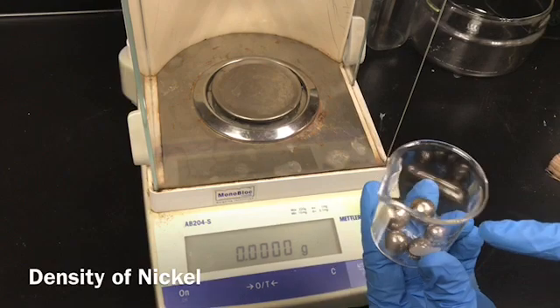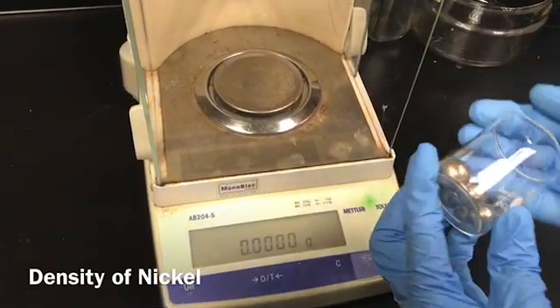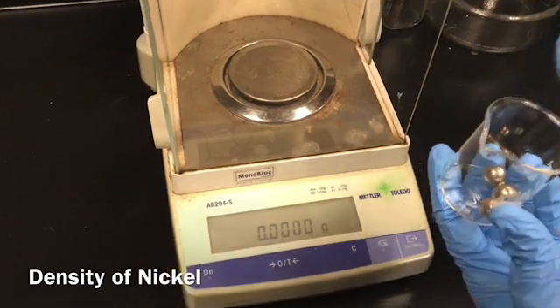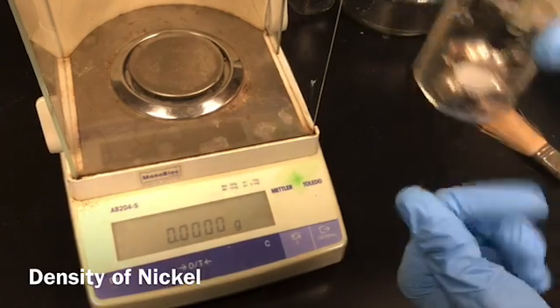Now I'm going to record the mass of the 50 milliliter beaker and the nickel spheres. Make sure you add the nickel spheres into the beaker very slowly, because they are pretty heavy and it might break the bottom of the beaker.